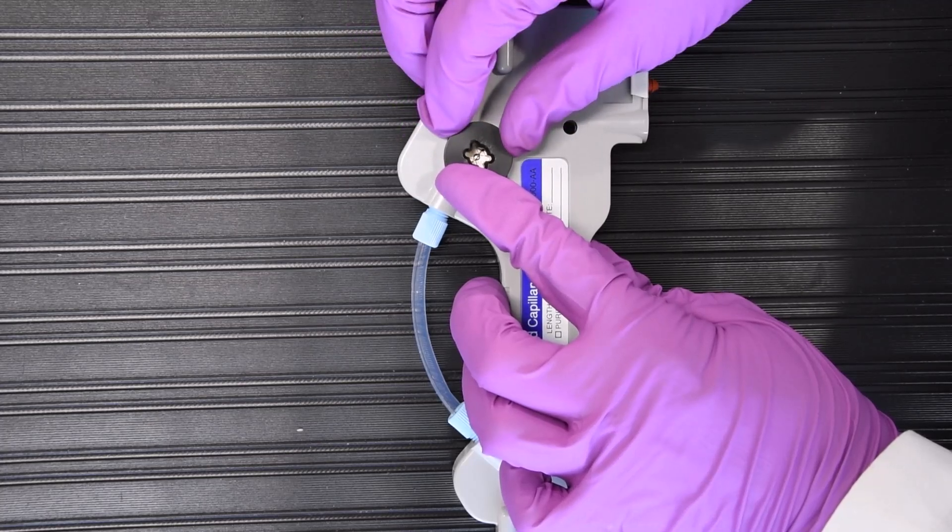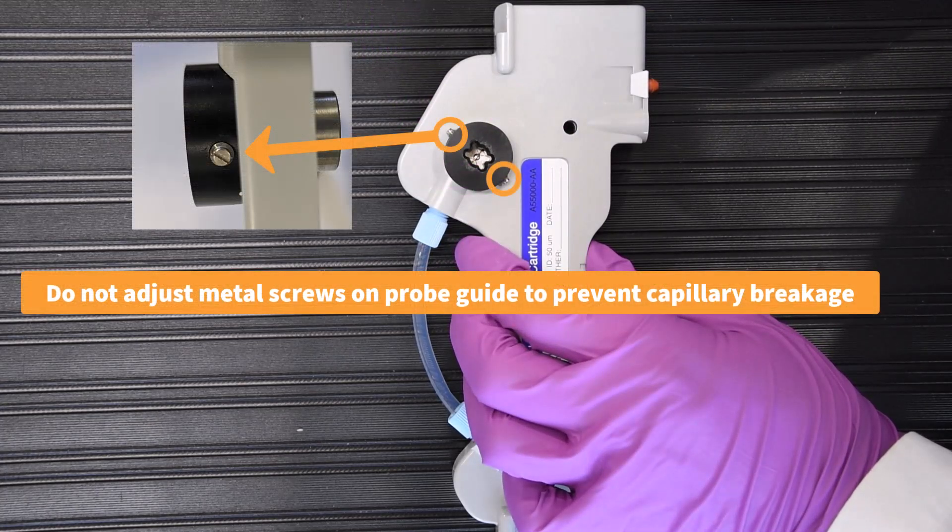Do not adjust the metal screws on the probe guide. They are preset to their optimal positions, so any further adjustment of these screws could cause capillary breakage.